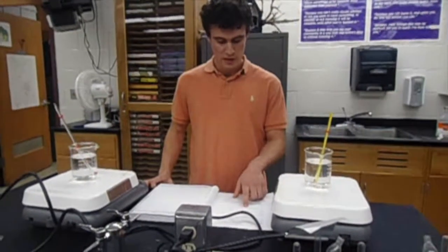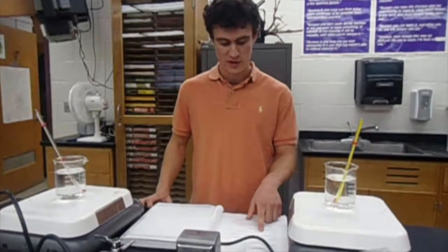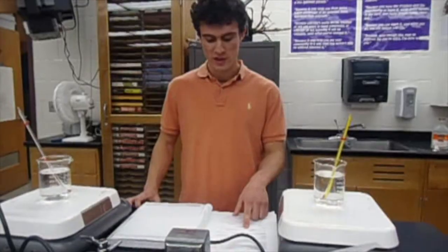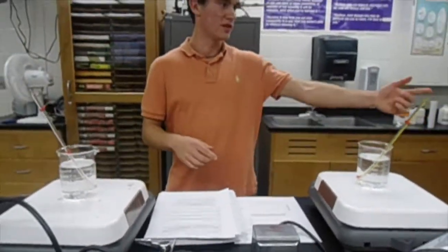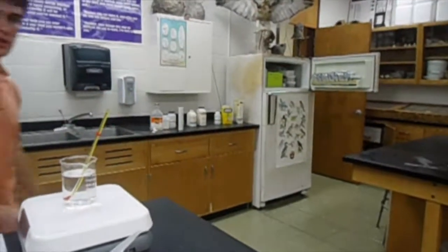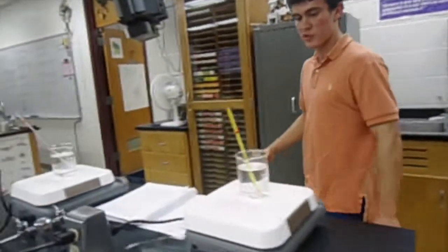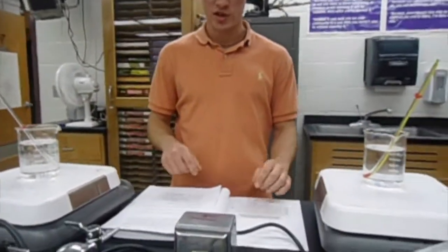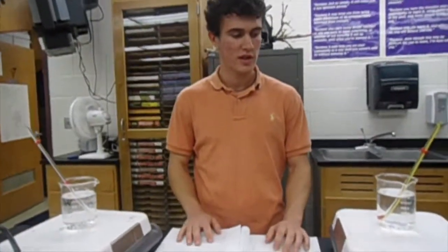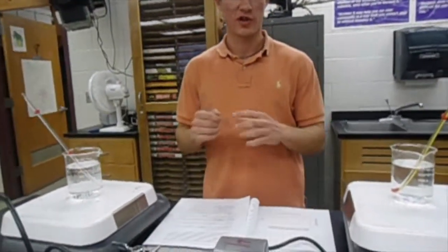We used yeast and 4 fermentation tubes, a ruler, sugar, water, measuring cups, 5 beakers, a heat source, and a cold source. The basic procedure of this lab is simple. First, and more importantly, you have to set everything up properly, mix the solution, and have the freezer ready to go. The setup's important. Make sure everything is ready to go and the right temperatures are set. You pour the mixture into the fermentation tubes, and after that you simply watch it and use your ruler, another important piece of equipment for this lab, to measure the carbon dioxide buildup.